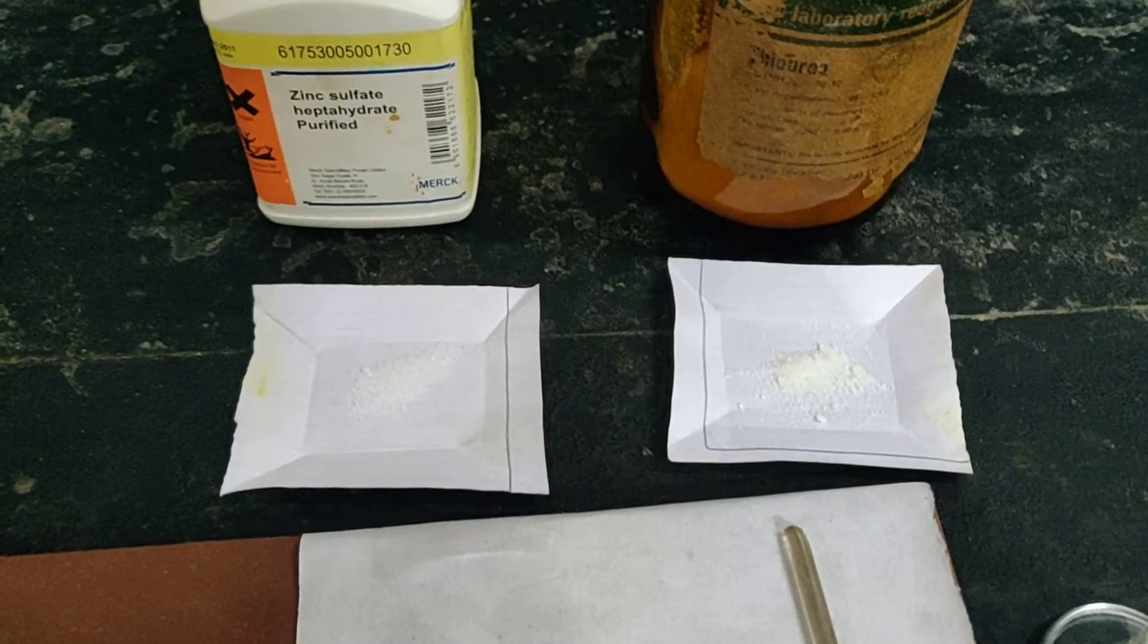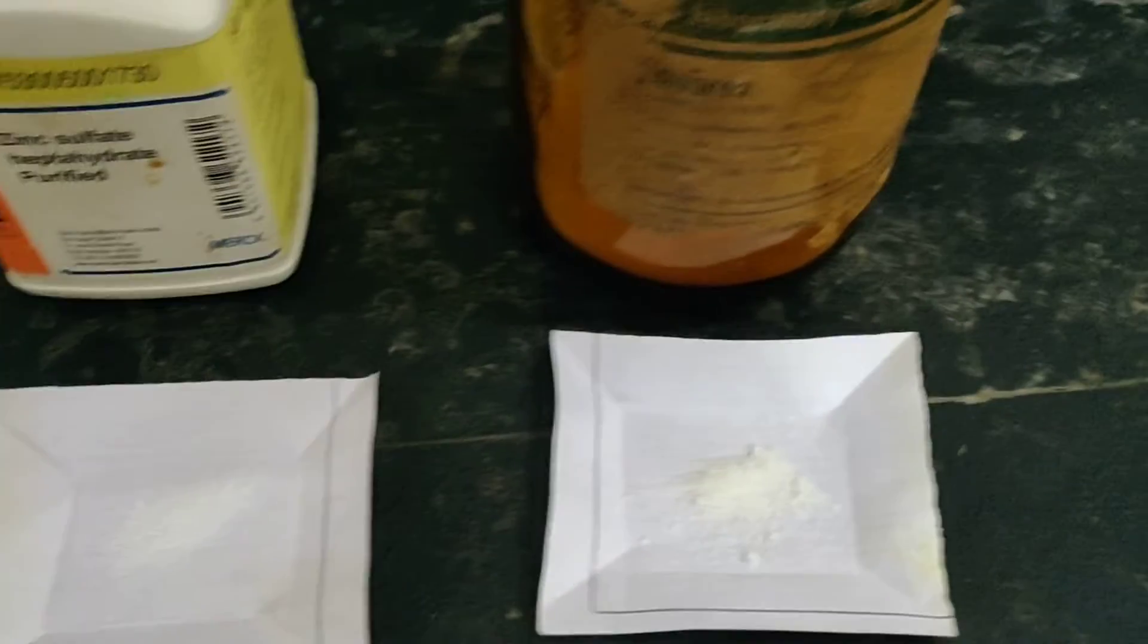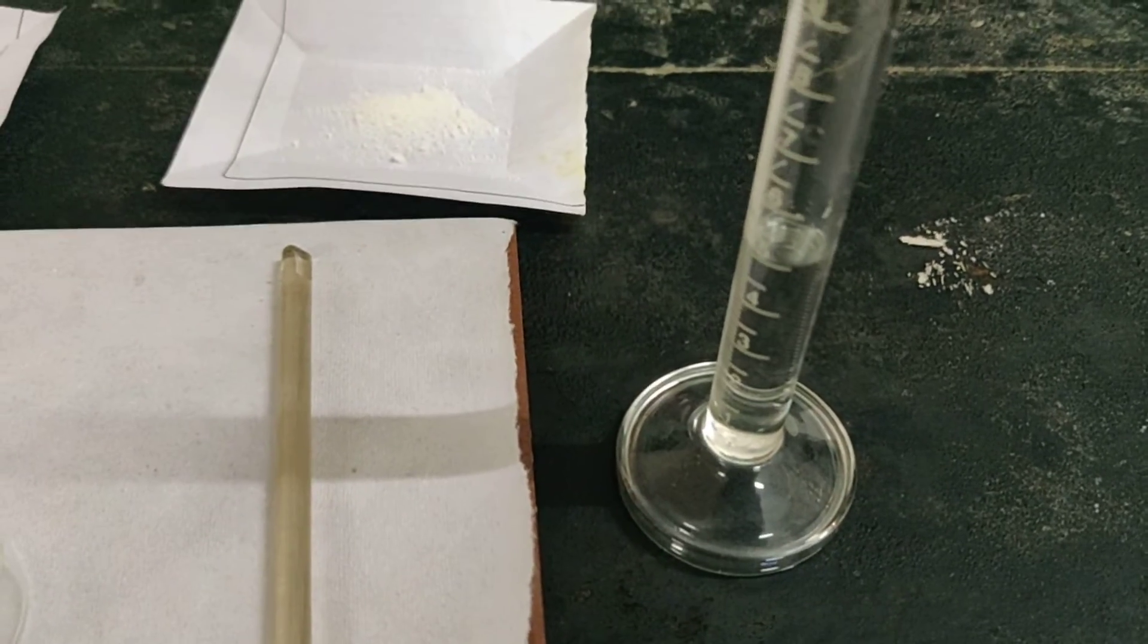Now let us perform the experiment. I have weighed 0.5 grams of zinc sulfate and 0.5 grams of thiourea, and here you have 5 ml of water.